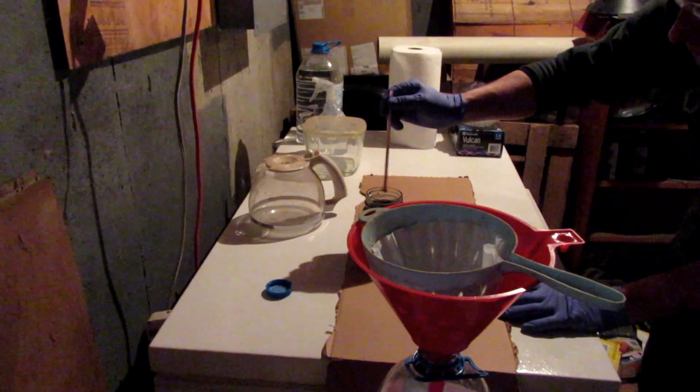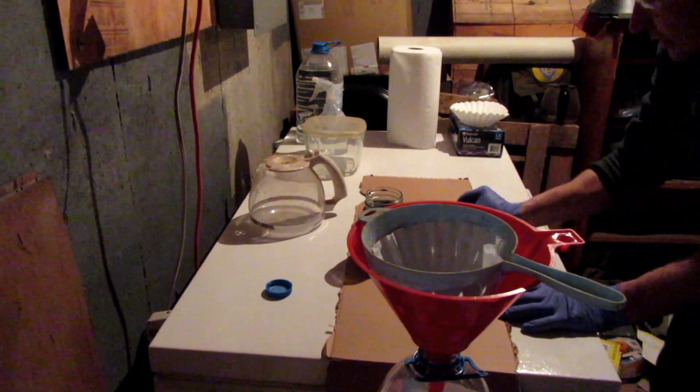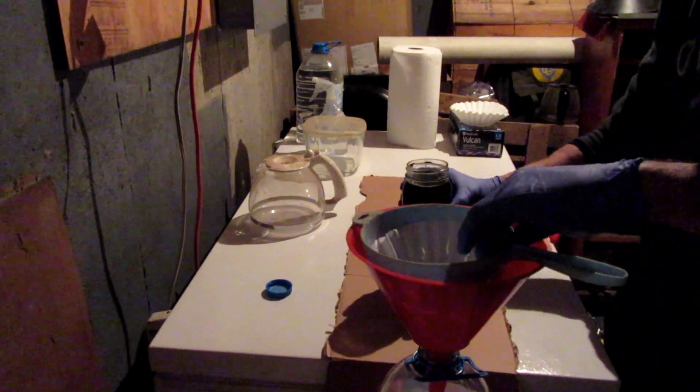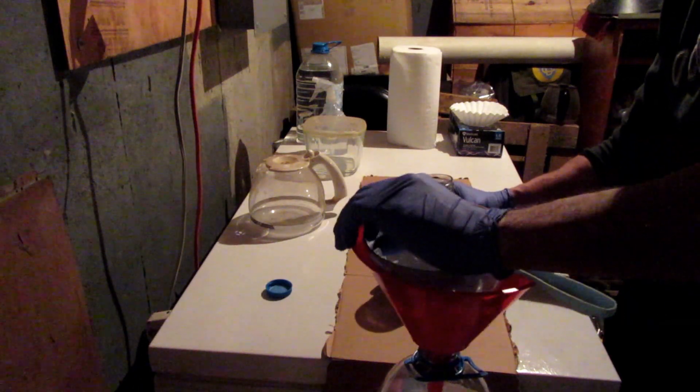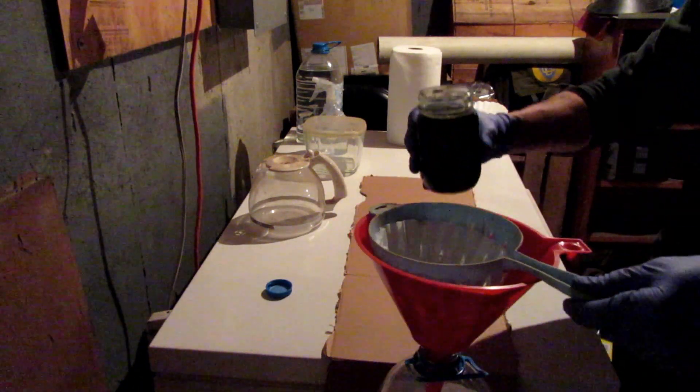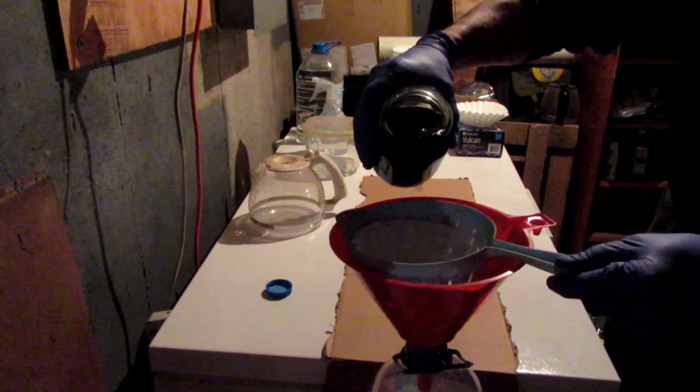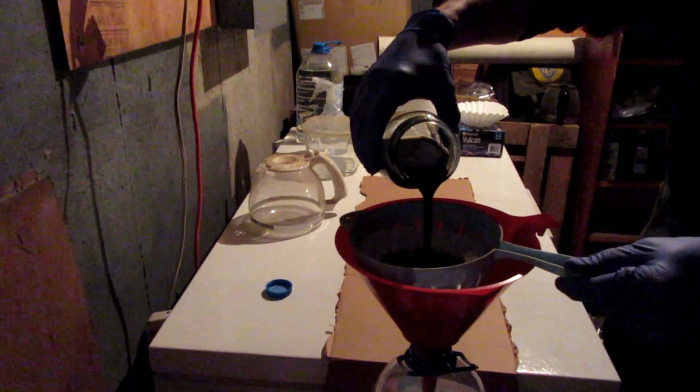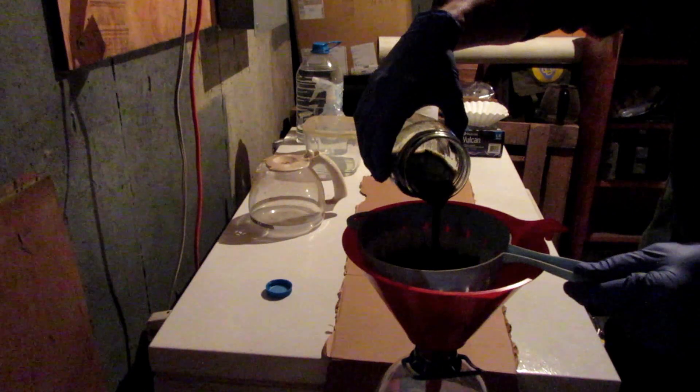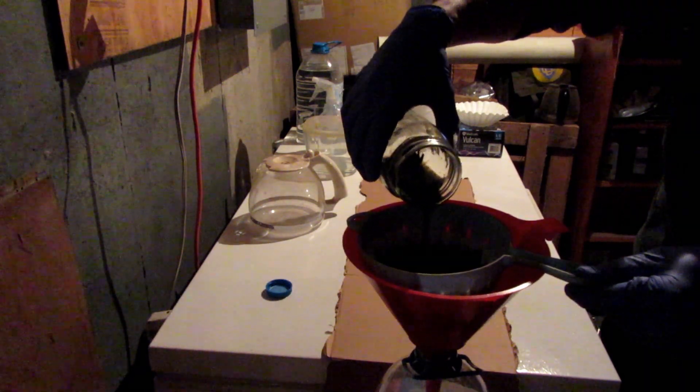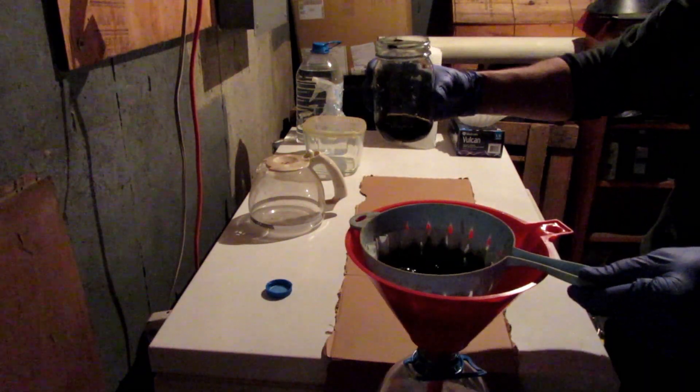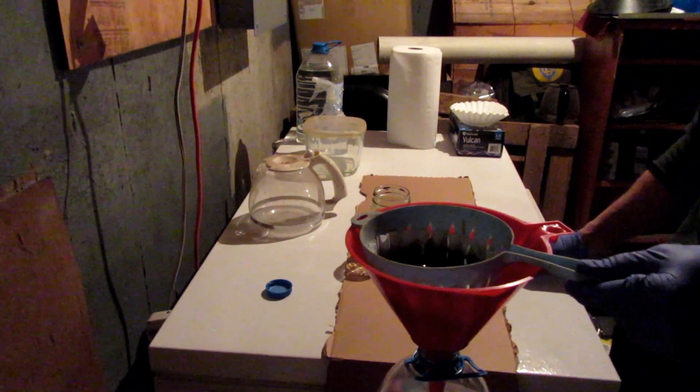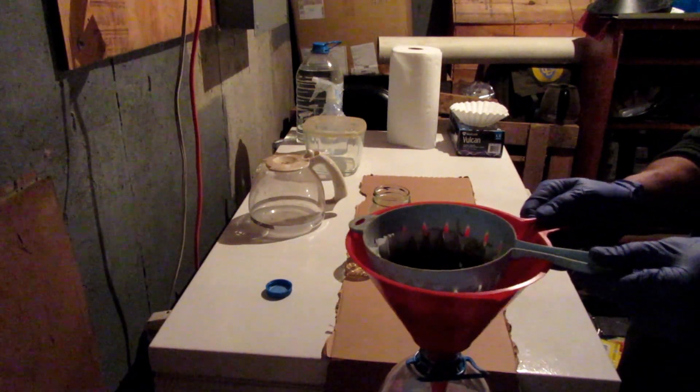Keep in mind that at the end of this process, everything that touches that liquid needs to be disposed of properly. Okay, so here we go. We've got it all stirred up. We've got the filter exactly the way we want it. And we're just going to go nice and slow and easy. We do not want to get all the way to the bottom of the jar, and we certainly don't want to get to the point where the liquid is overflowing the filter. Those are the two things we want to avoid. So now we're just going to patiently wait for that to get through the filter.